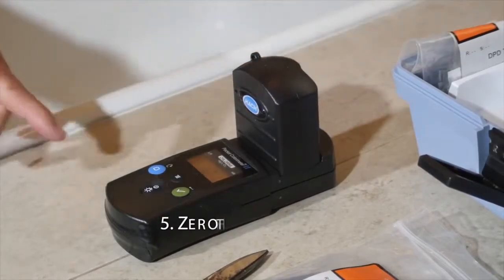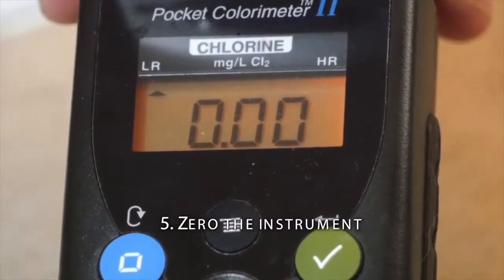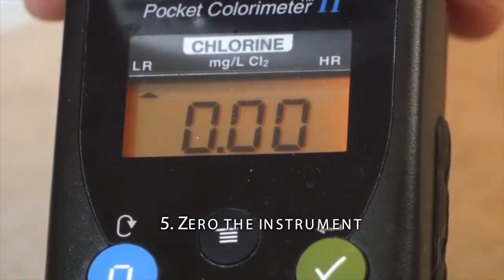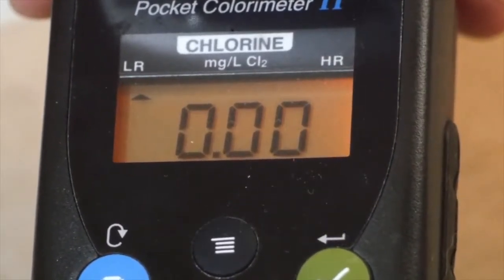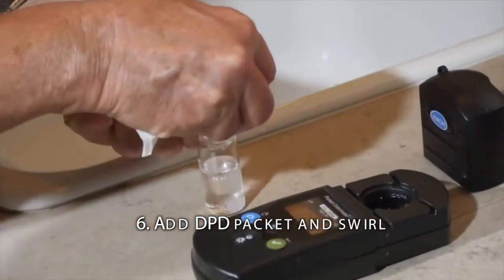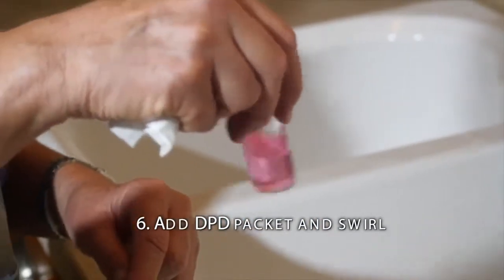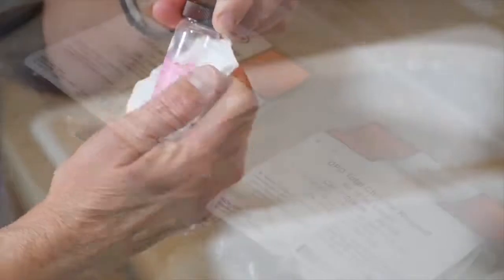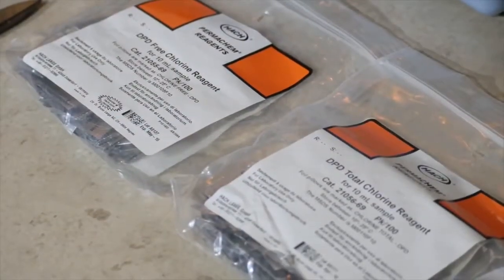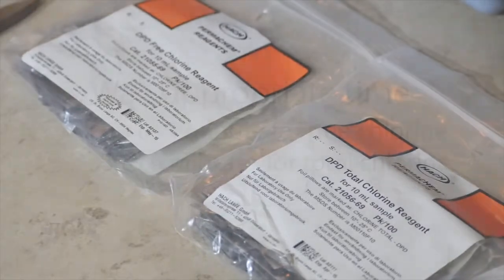Press the 0 button on the instrument. This zeroes the instrument for your sample and accounts for some interferences in your sample. Add the DPD packet to the sample and swirl. Here's where procedures vary if you are measuring free chlorine or total chlorine. There are different DPD packets for free and total chlorine. Make sure to have the correct packet.